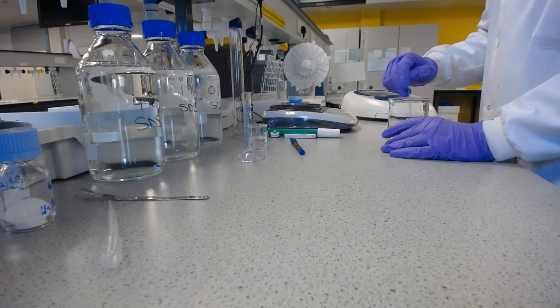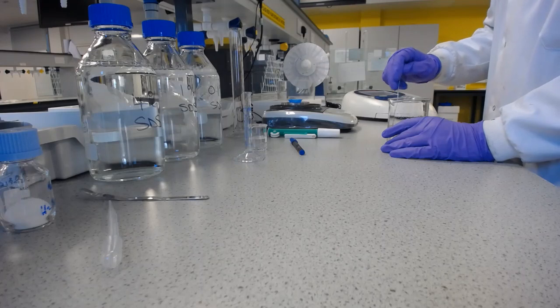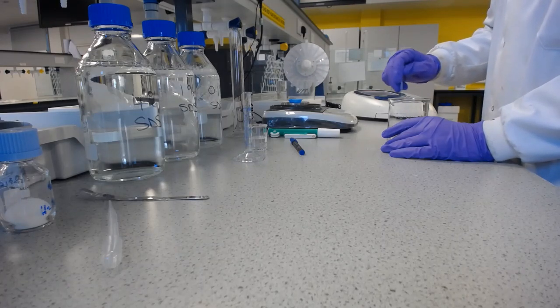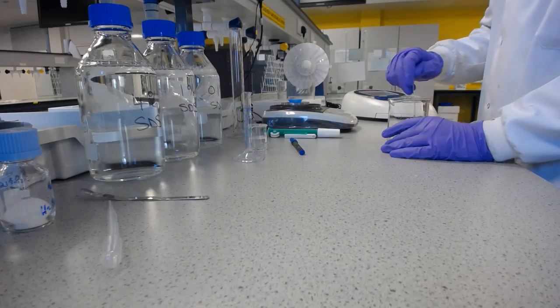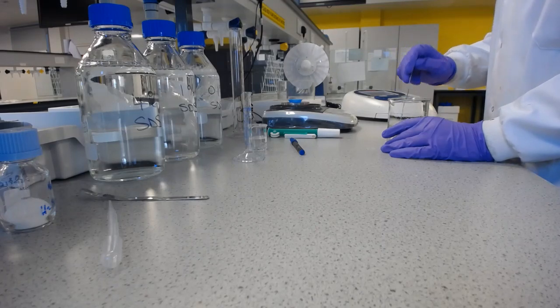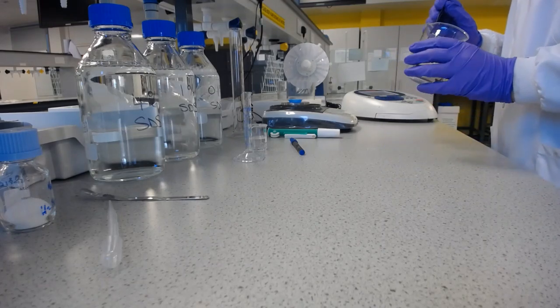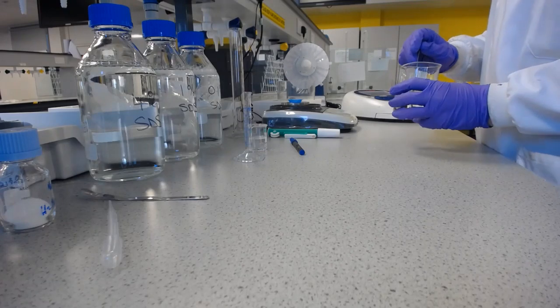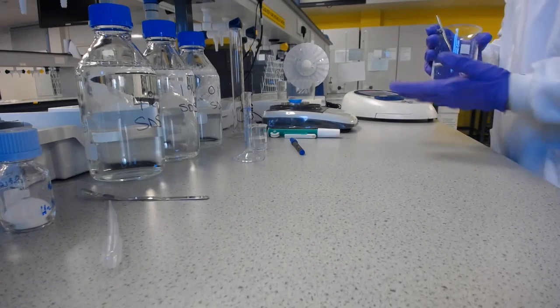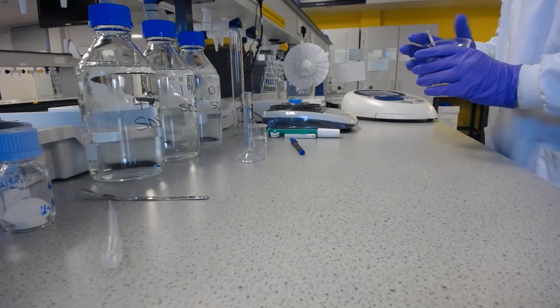And you know that it's not going to be that soluble, because we're having to put 8 milligrams in 100 millilitres of water to get a calibration curve in roughly the right area for what the actual solubility is going to be. So logically, and just by thinking about it a bit, you'll be able to work out that we're not going to be talking about a very soluble material here.